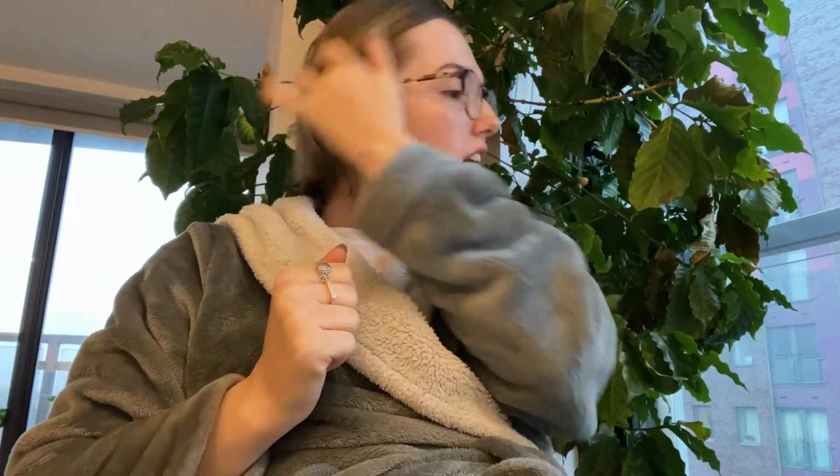Right, day two of trying to figure out the microscope. Well, not the microscope. The microscope is fine and dandy. It is the flow system and the computer that are not talking to each other. So I need to figure that out.